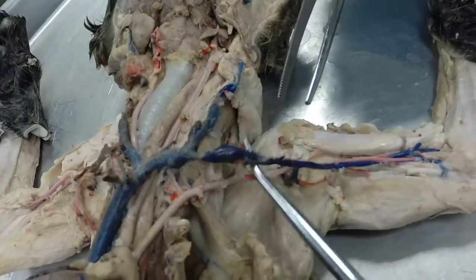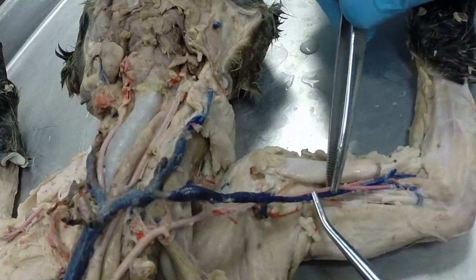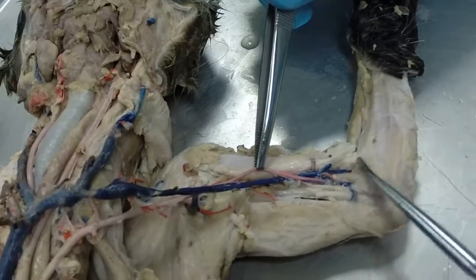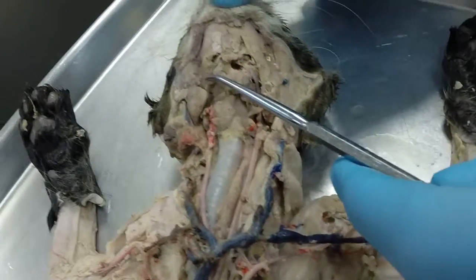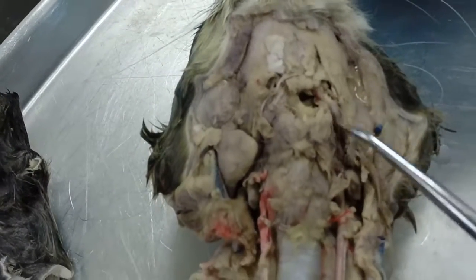The left axillary vein is simply going to continue out across the arm, at which point we call it the left brachial vein right here. And then where it turns at the elbow, we call it the left median cubital vein right there. Okay, we also are supposed to have this vein going across here. This would be the transverse jugular, but in this cat it's missing.